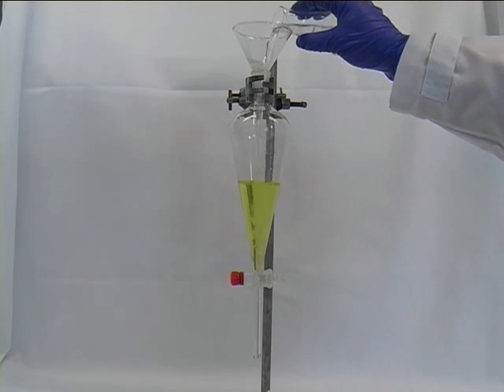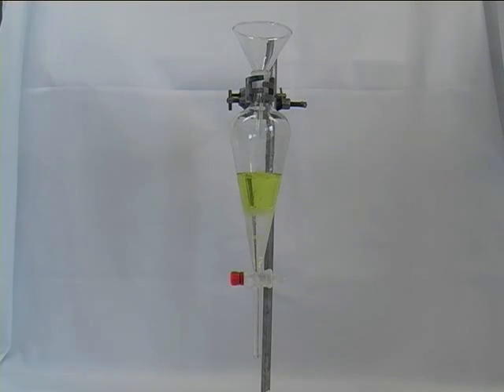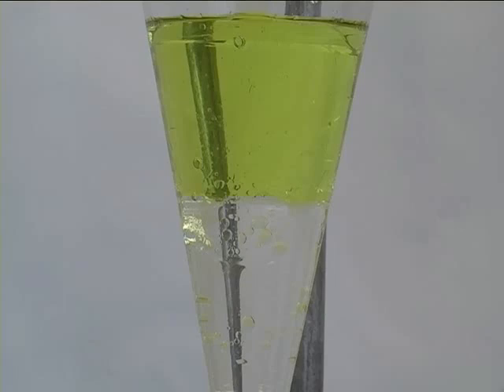Secondly we add our aqueous phase which we are going to use for the extraction of any solute that we don't want to have in our organic phase. Here you can see the two layers separated by the interface.